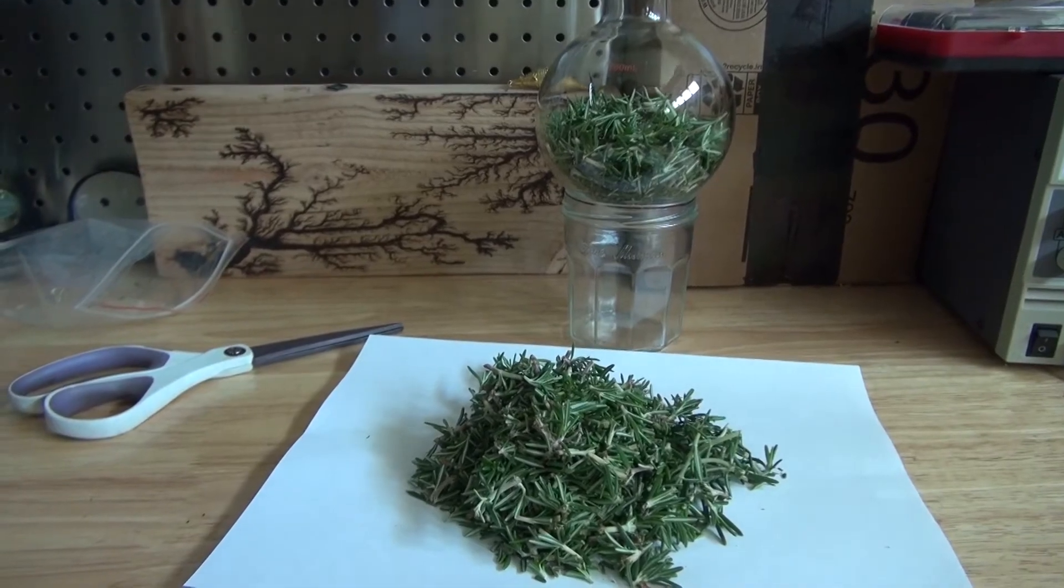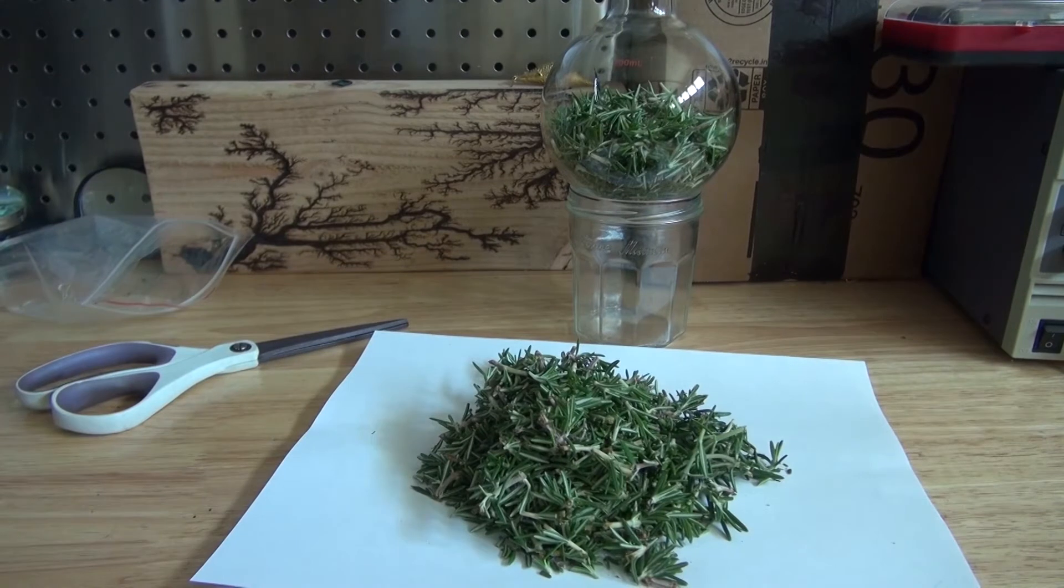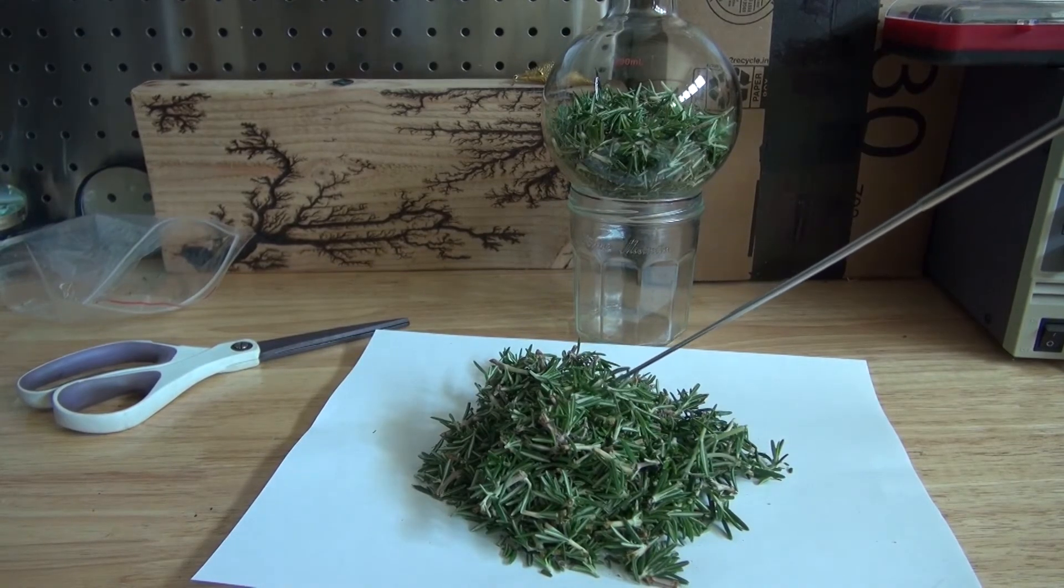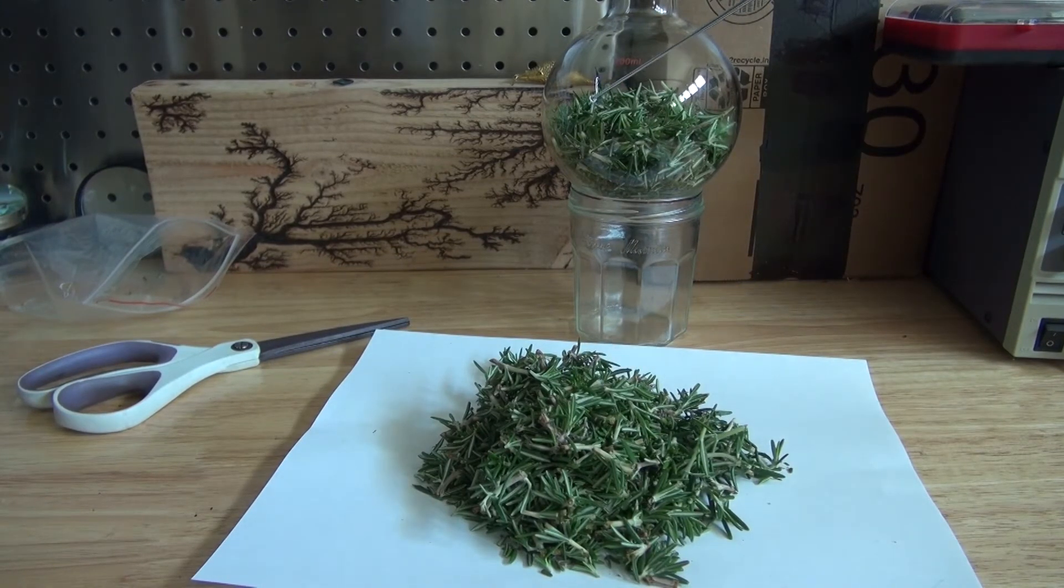As you can see I have two batches. Fill the Florence flask only halfway. If you fill it to the top it'll cause it to overflow and make a whole mess in your distillation apparatus.